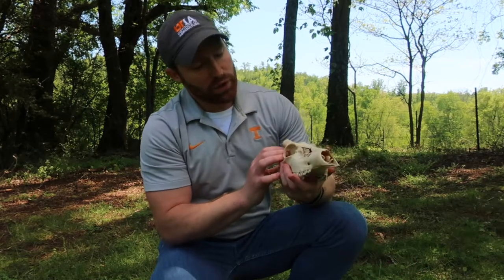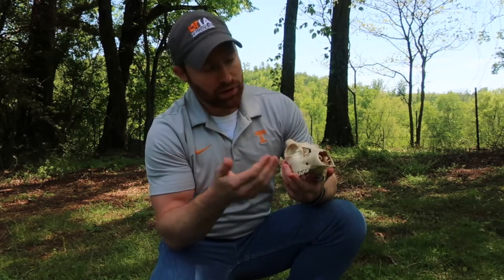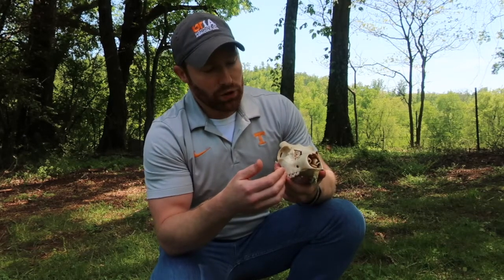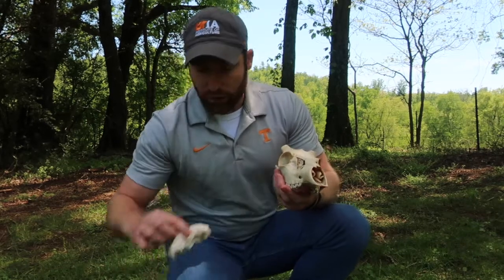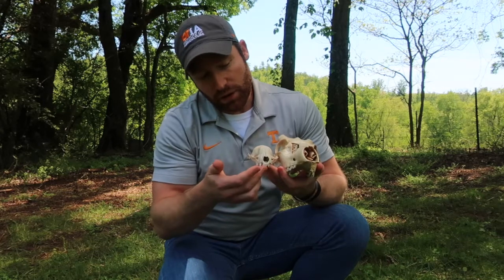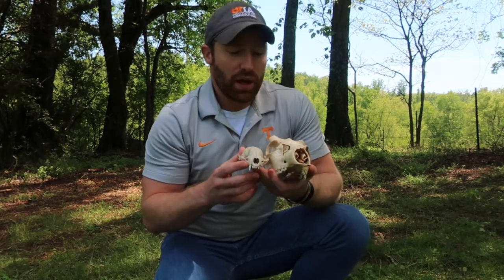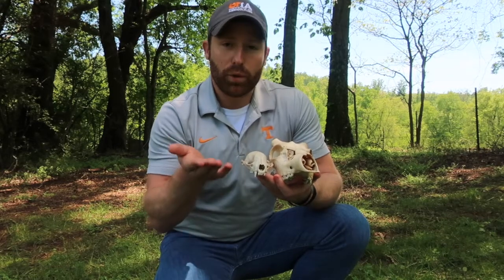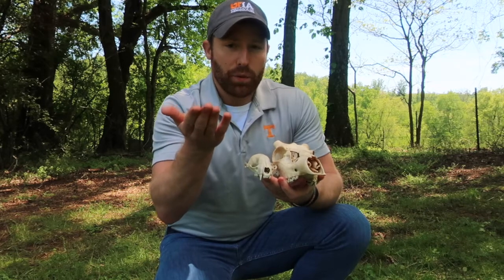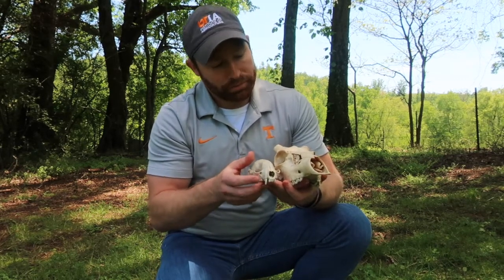So one other thing I want to mention is that ruminants here, like this young deer and like the calf we'll show you in a minute, don't have these front upper incisors that I showed you here that this animal would have had in the front, and so that's a little bit different also. So this animal has these incisors in the front here. Cattle and deer don't have these incisors. They actually have a really hard upper palate that allows them to press the grass up to the top of their mouth and kind of tear it off as they pull away or as they chew it.